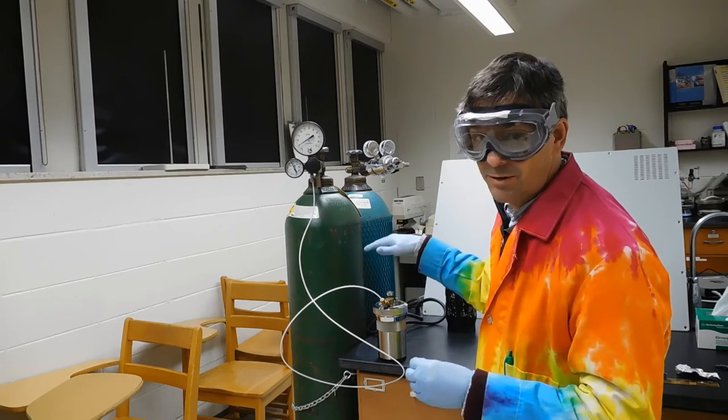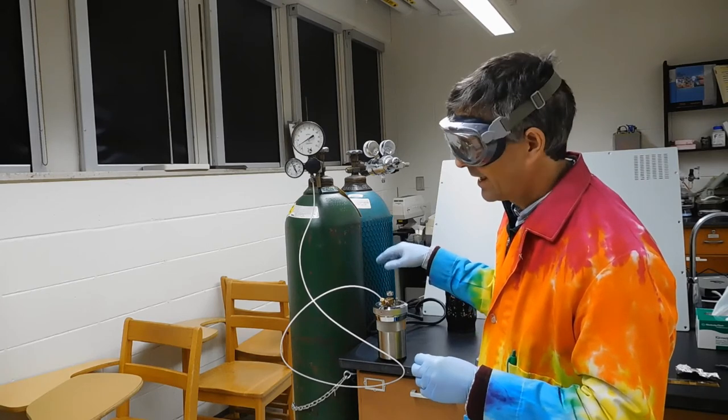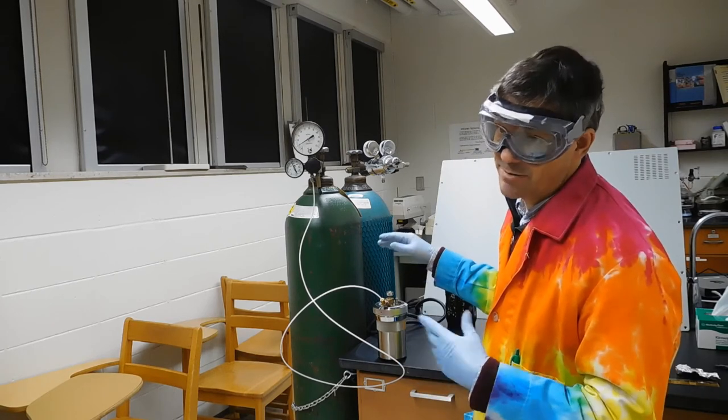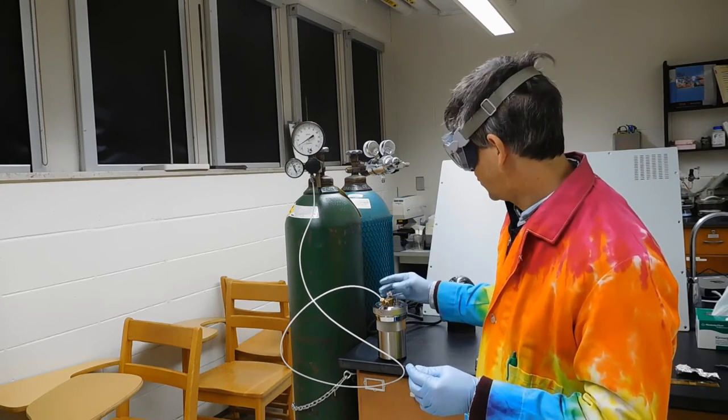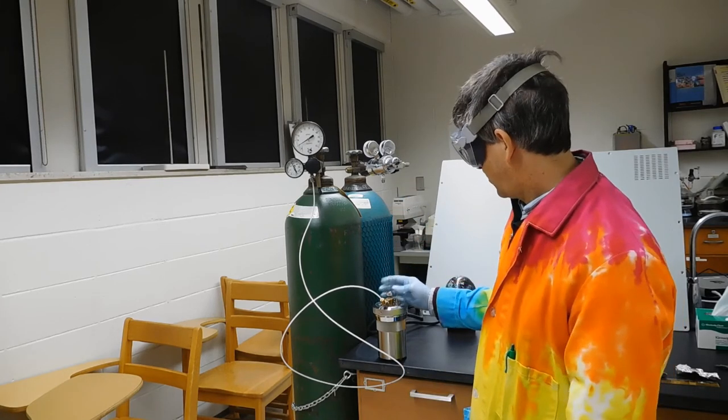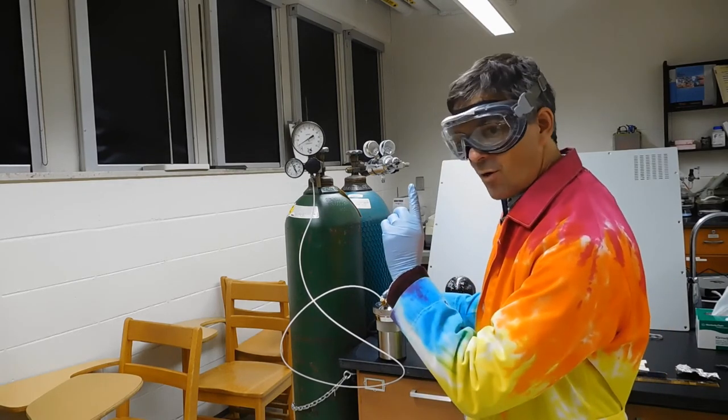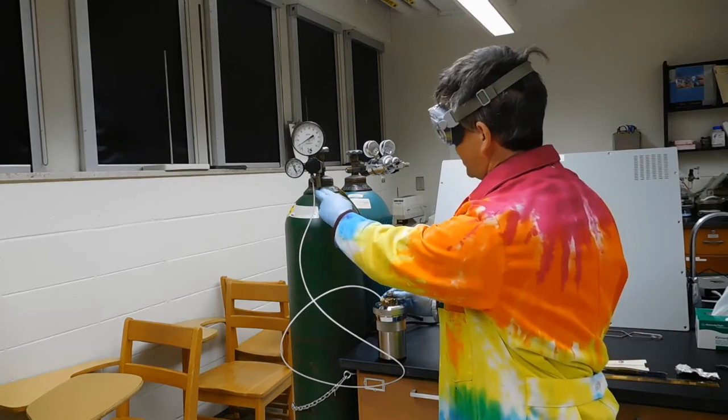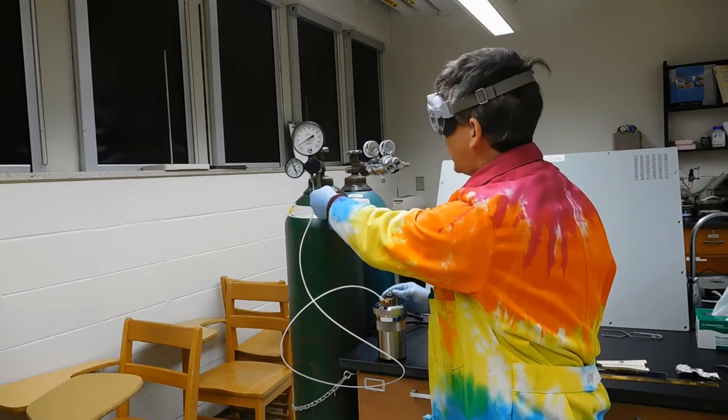It's been blowing here for about 35 seconds. Since this is just a demonstration, I'm actually going to stop. What you do is you can close this valve, and the pressure will start to go up. Before you start to close this valve, you need to get ready on this valve, because what you'll do is push this one down when you reach the desired pressure.